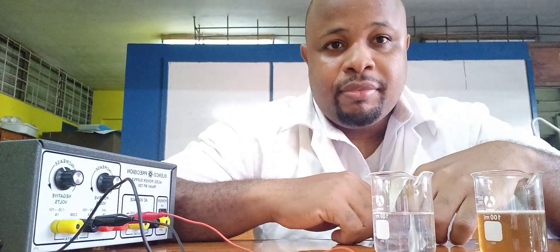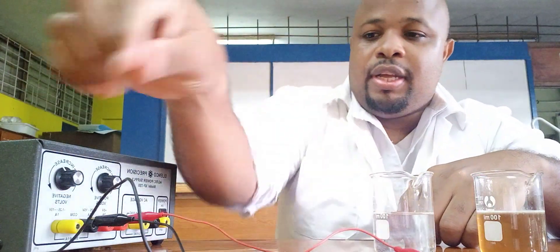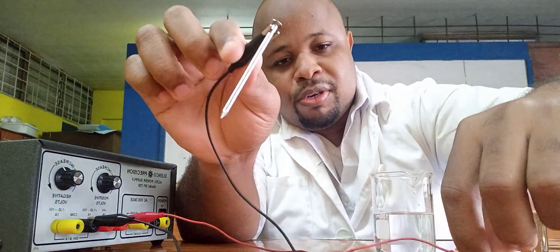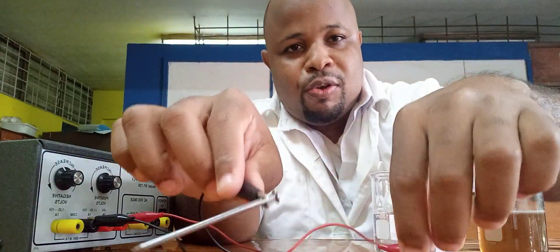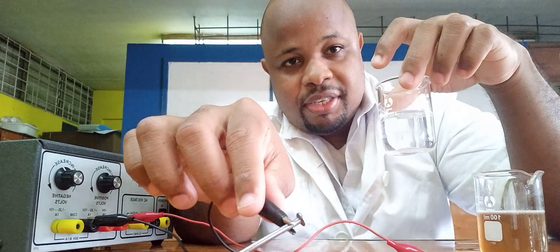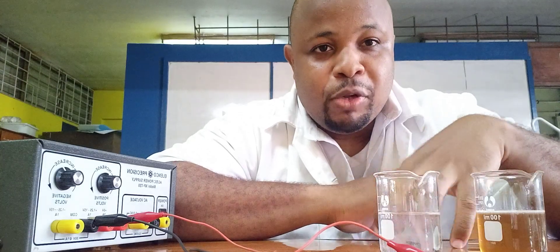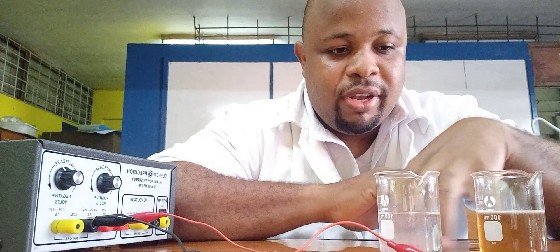For the source of our electric current, we have a power supply. We have a piece of copper metal and a nail, so these are our electrodes. When we put these in our solutions, if the solution is an electrolyte, something must occur — we must see some form of visible reaction.